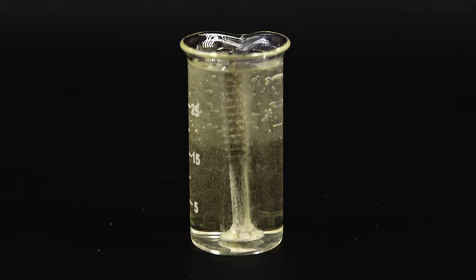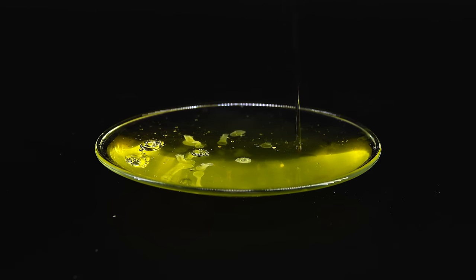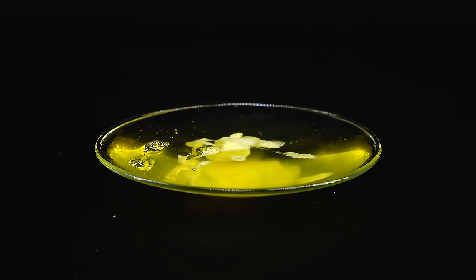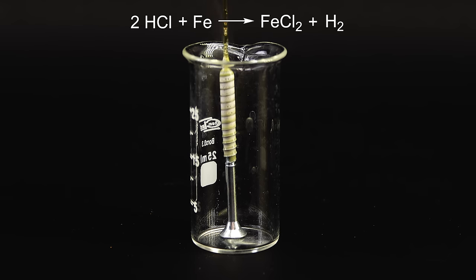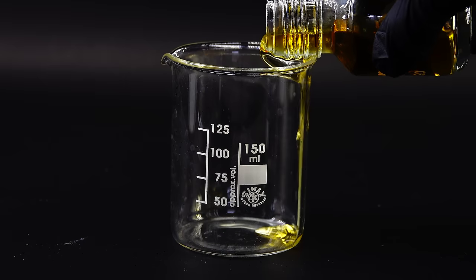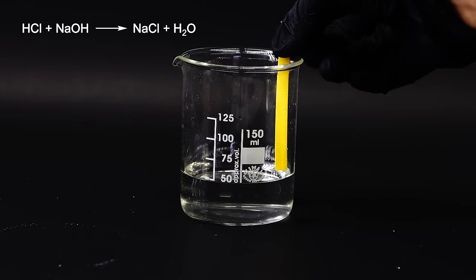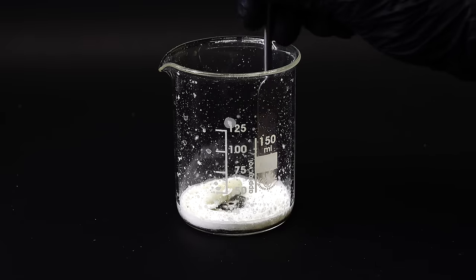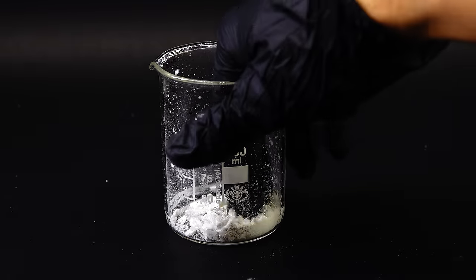Now for some experiments with my acid. I decided to first test how it reacts with proteins, so I got this egg white — and upon combining it with the acid, you can see that it becomes white, looking like it's cooked. This nicely shows what it would do if you drank it; you might think you can since it's already in your stomach, but your stomach is specifically designed to be resistant to it while your throat is not. One more thing this acid is good at is dissolving stuff — it reacts with metals like iron and aluminum, producing hydrogen gas and their chlorides, which are often really colorful and useful chemicals. And now for a fitting end of this journey, I can react my hydrochloric acid with some sodium hydroxide, which through a neutralization reaction creates the almighty table salt — almost poetically symbolizing how you can waste hours of your work, but also demonstrating deep connections in chemistry.